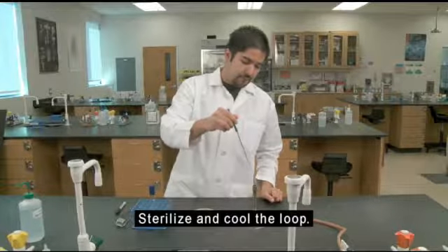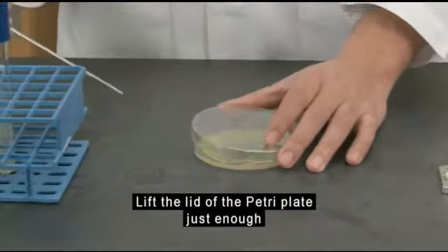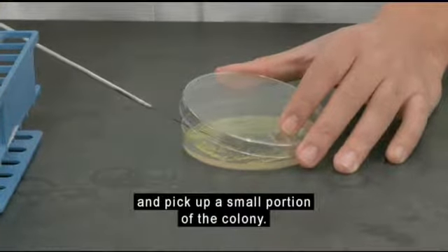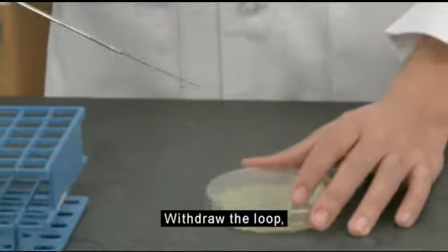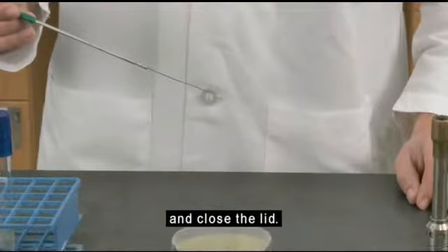Sterilize and cool the loop. Lift the lid of the Petri plate just enough to allow you to insert the loop and pick up a small portion of the colony. This technique prevents airborne bacteria from falling onto the agar. Withdraw the loop, taking care not to touch the Petri plate, and close the lid.